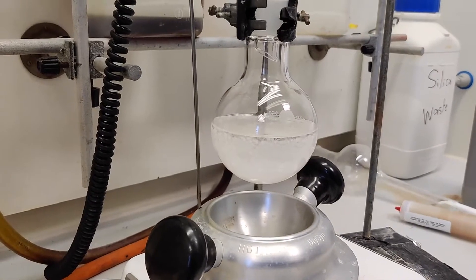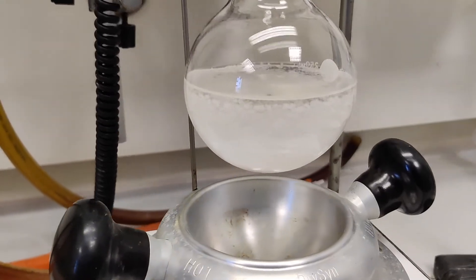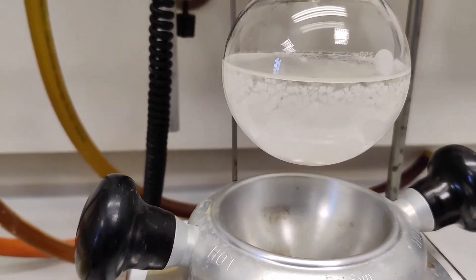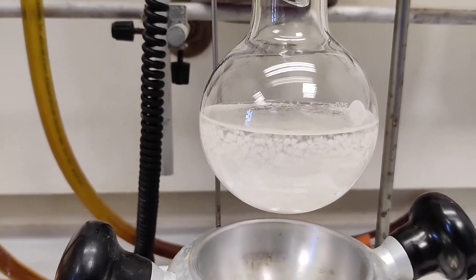As you can see, our product has recrystallized after cooling to room temperature. This was left for about an hour, hour and a half. And all these white crystals are our cyclized product, which we will now filter and re-purify.